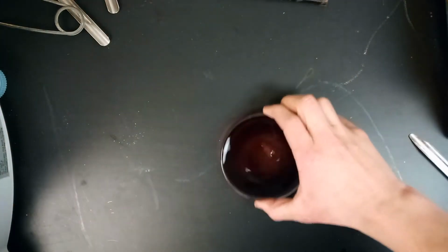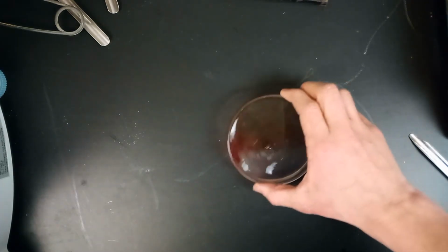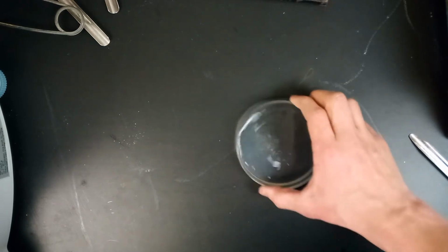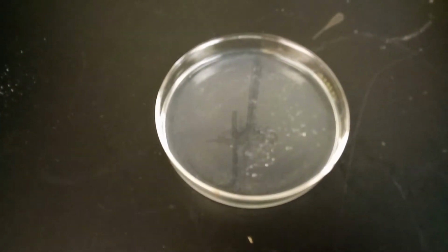You'll see here that inner circle where the crystals were added is turning much lighter during this time interval. It'll be even more apparent now when we swirl it and the solution becomes clear. So adding the sodium phosphate in this step turned the solution back to being clear.